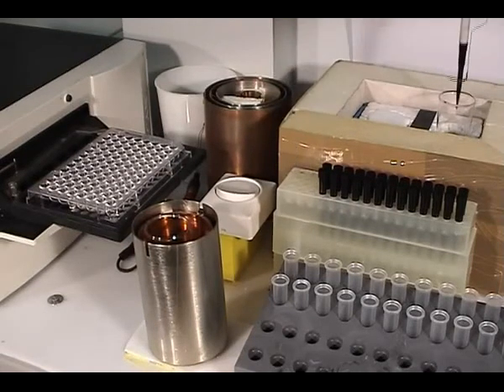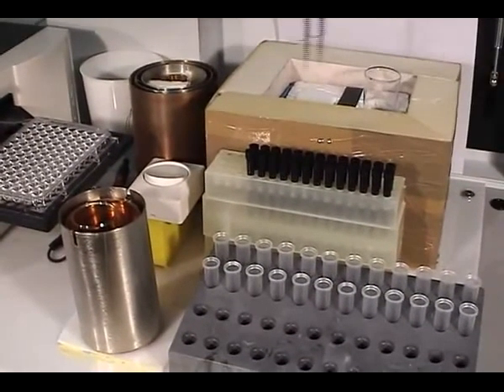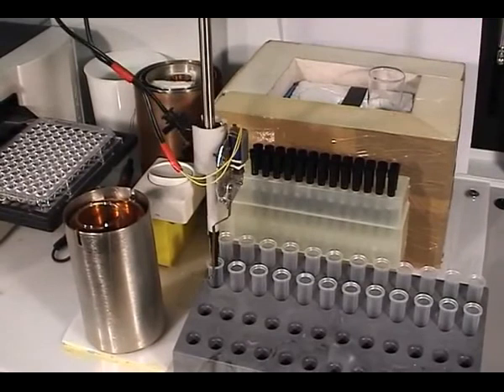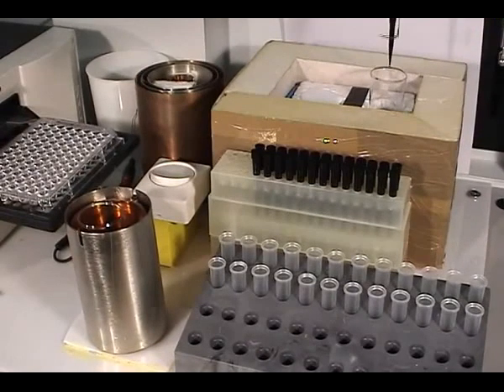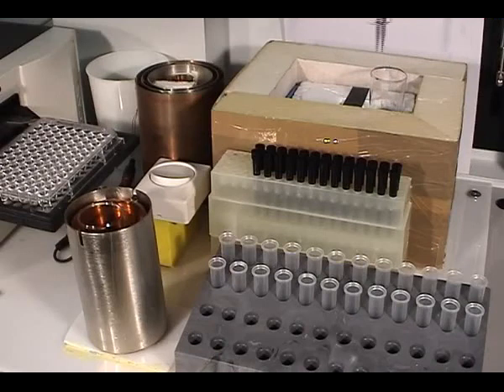Now it's collecting the plasma and will put it in front. Each sample is always 200 microliters, so that will be 200 plus 200, 400 microliters.